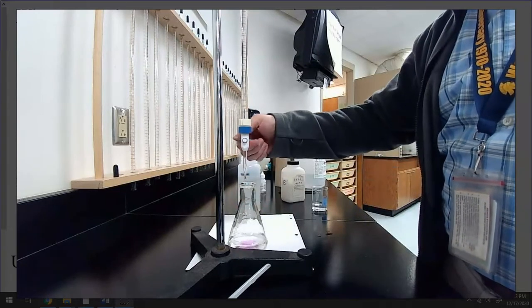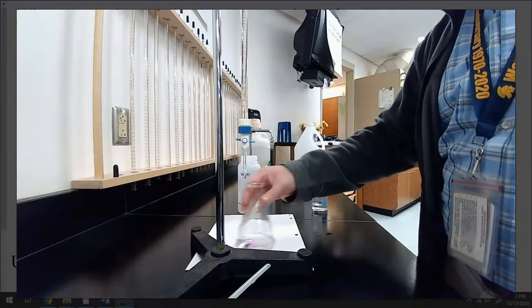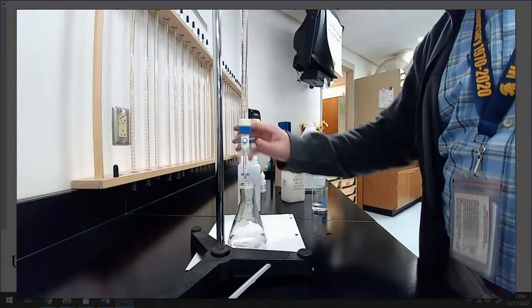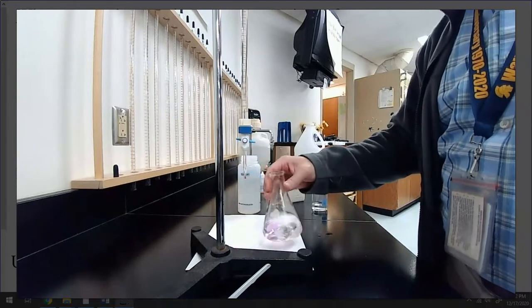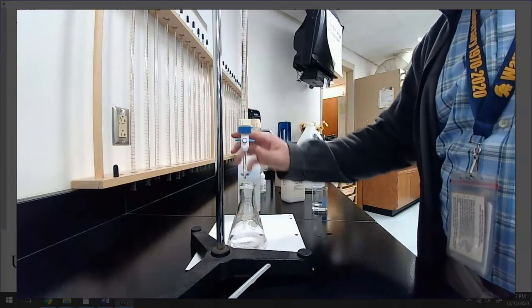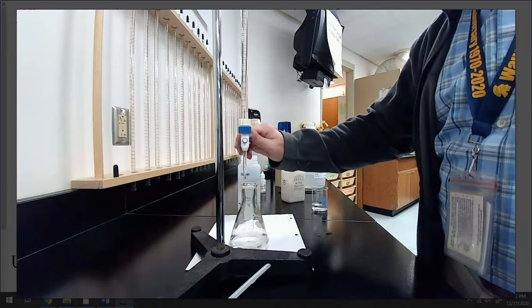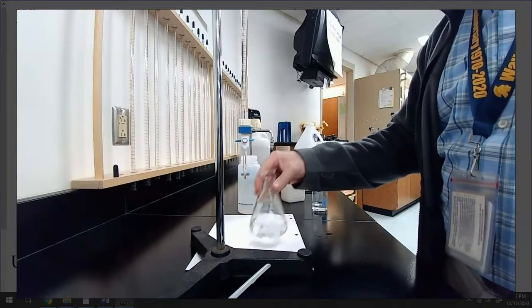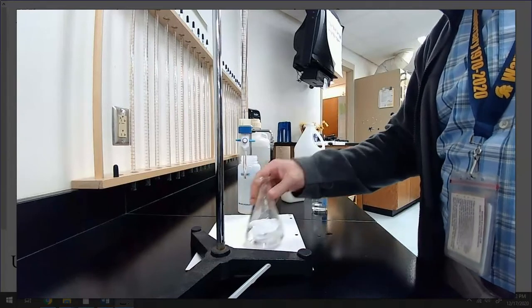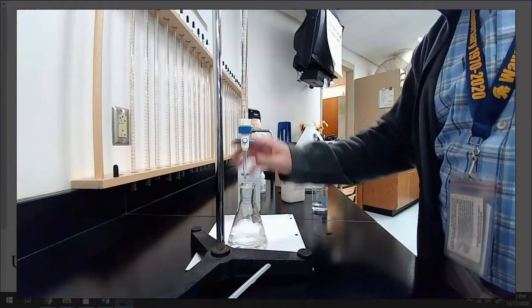Okay? And I'll do that a couple times. I think I'm still a smidge away. I'm going to go a little slower. It's not far, though. I can feel it. This is the excitement of titration. It's playing with the end point here. Oof. Thought it was going to stay. Okay, now we got to be careful.